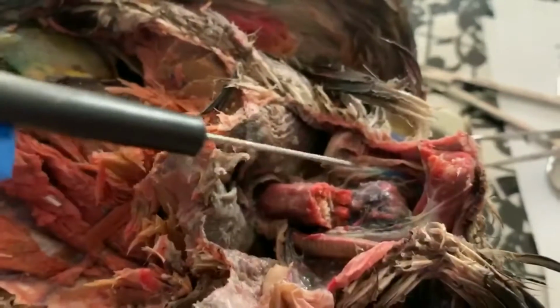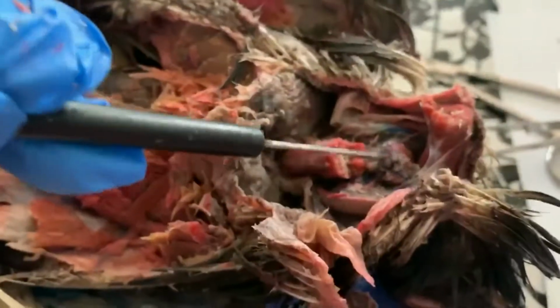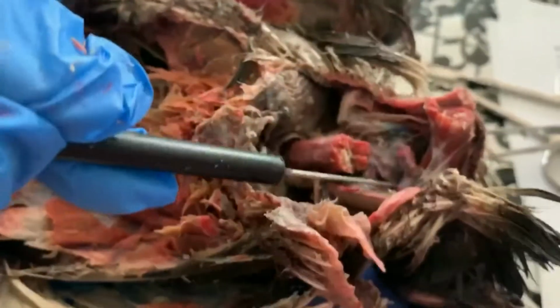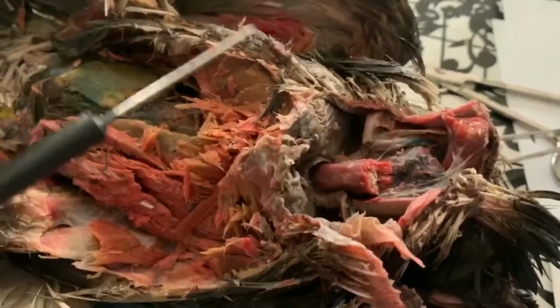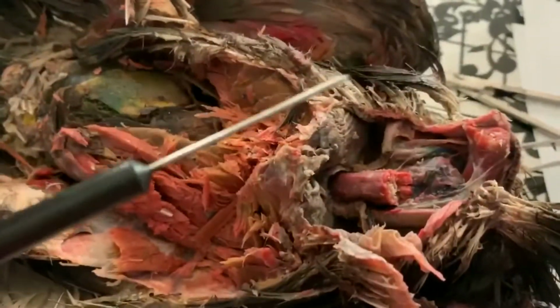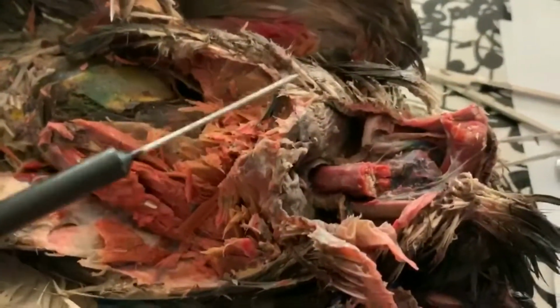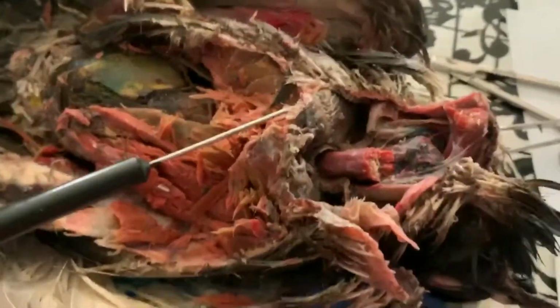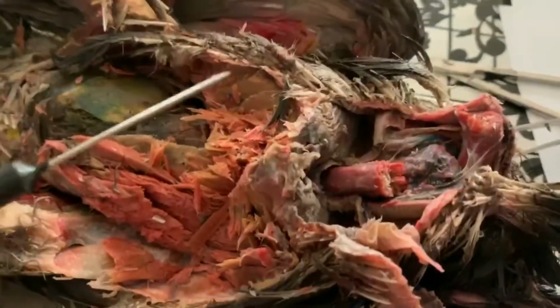So if you've ever dealt with cows, cows have a multi-chambered stomach, okay? Birds, what a lot of birds have is something called a crop or a gizzard, all right? This is a pouch that they actually swallow rocks in. And so the seed goes to the crop to have the husks broken off of it before it ever gets swallowed down the esophagus. So we see this particularly among seed-eating birds, that they have this pouch that they put rocks in to be able to kind of break off the husks of seeds.